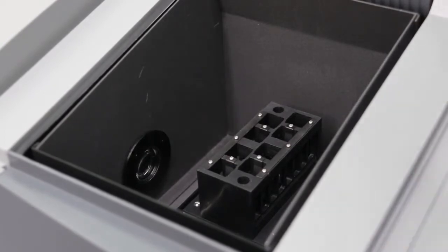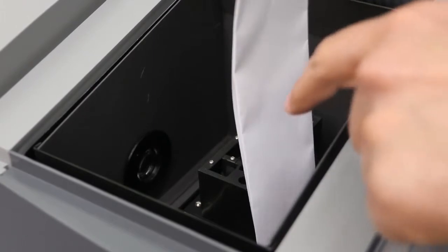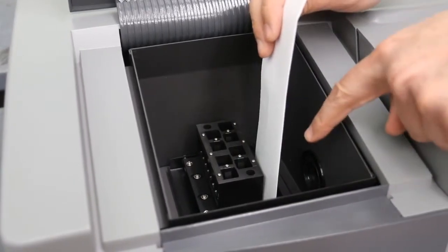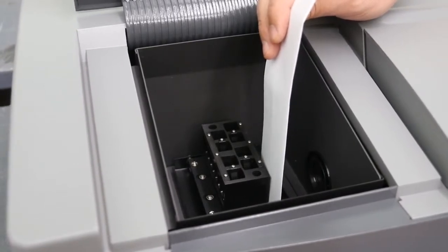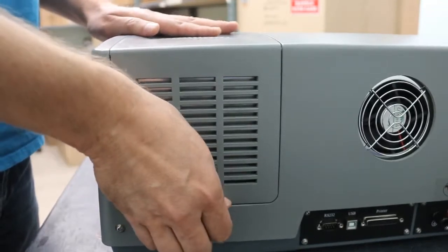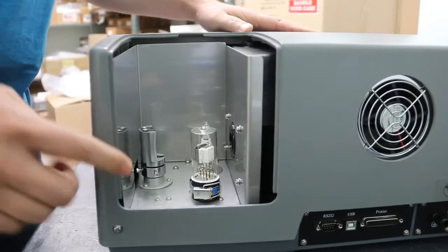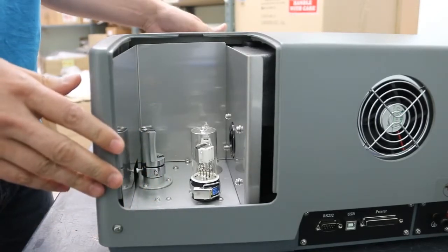You can take the paper and also hold it in front of the sample holder to see that the light is exiting through the output. If you do not see the light exiting here, then you will have to adjust the mirror. In order to adjust the mirror, the whole cover will have to be removed. These adjustment screws are only accessible when the cover is off.